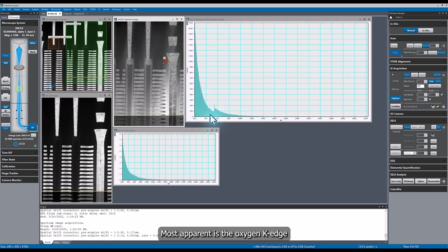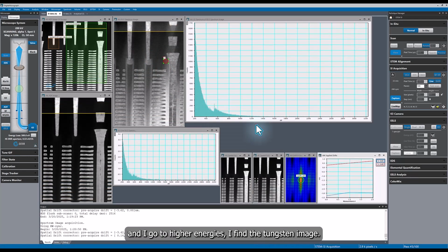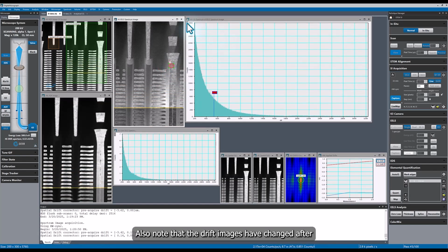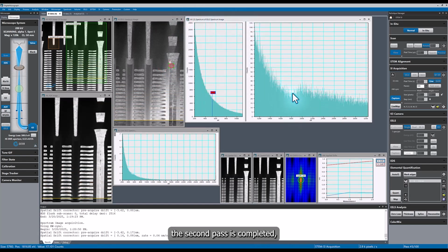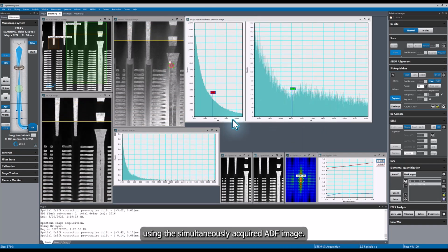Most apparent is the oxygen K edge. If I go to a different feature and I go to higher energies, I find the tungsten M edge. Also note that the drift images have changed after the second pass is completed, and the drift measurement is being performed using the simultaneously acquired ADF image.